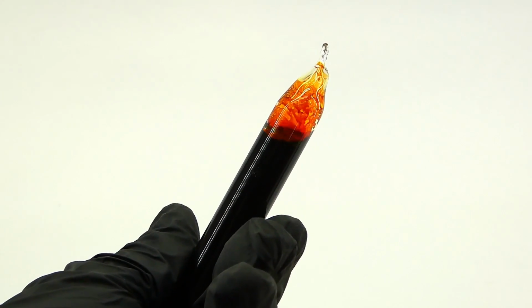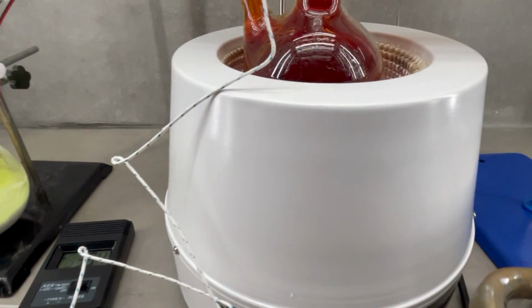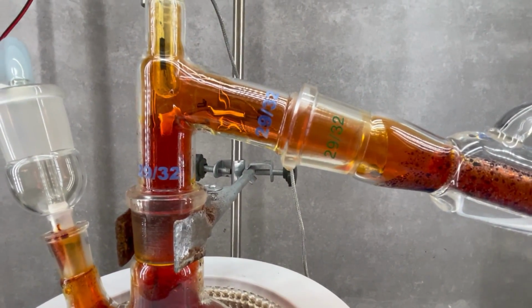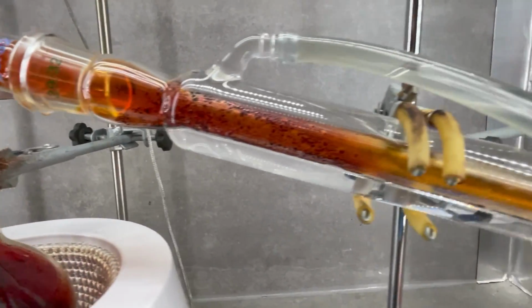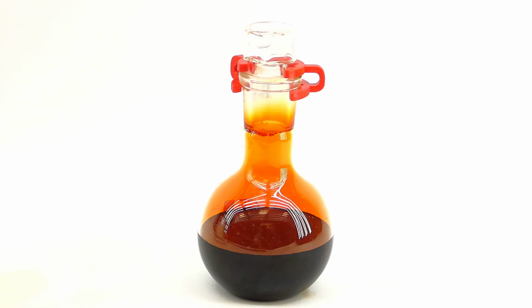To make it, I used the classic method involving making chlorine from pool tablets and displacing the bromine with it. This method is really simple and fine for making a sample for an element collection, but for chemical synthesis it has a few problems. The first one is that for my project I will need bromine in large quantities, and it is really difficult to scale up this method.